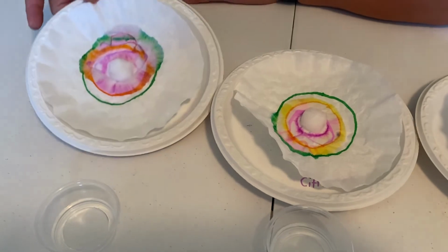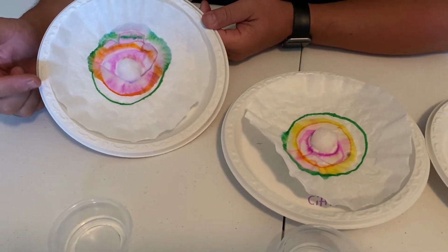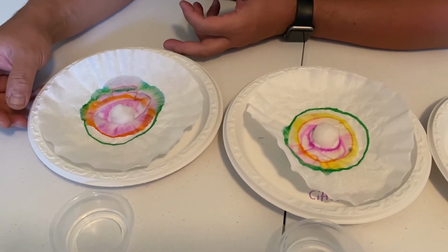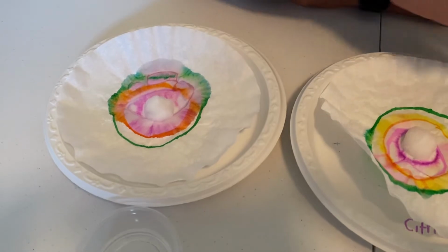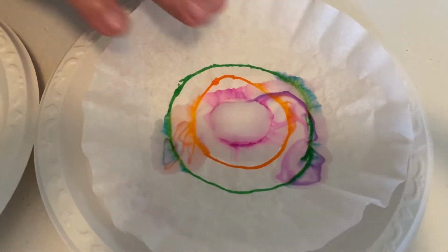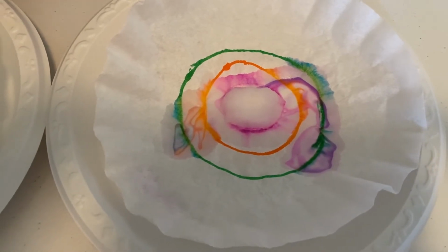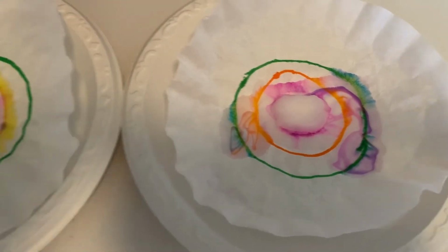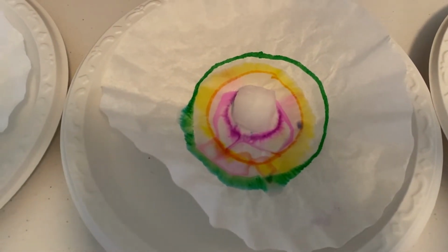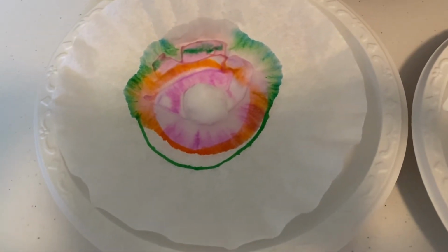But here you have it. If you look at this, the water one is actually separating it a little more. The alcohol, like I said, there's a little bit of separation going on there. You can see some blues coming out and things like that, but it's not happening as quickly as it did with the citric acid and the water. And that's due to the fact that it's water-based ink. It's not soluble in the alcohol itself.